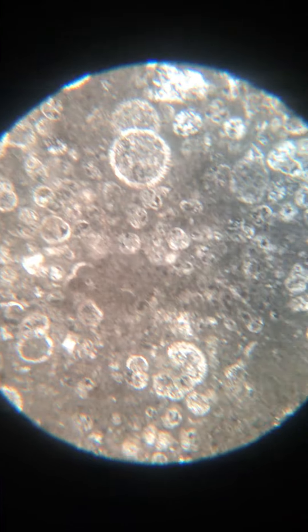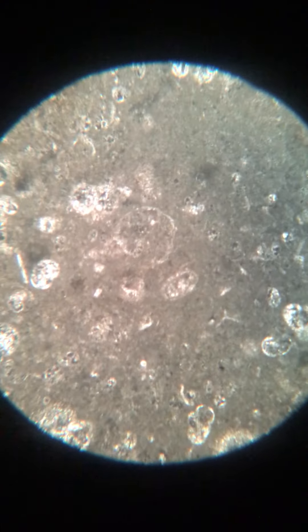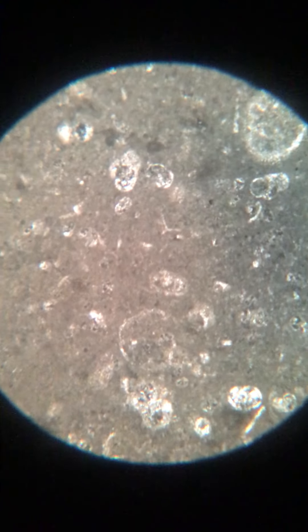When we put this to cross-polarized light, it's a little darker but there is no significant difference at this low magnification. If I were to change the objective, I would have to refocus.